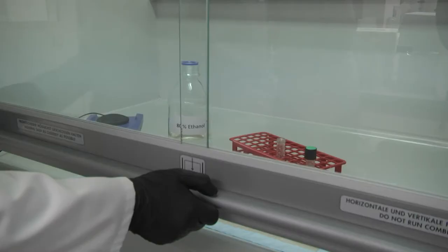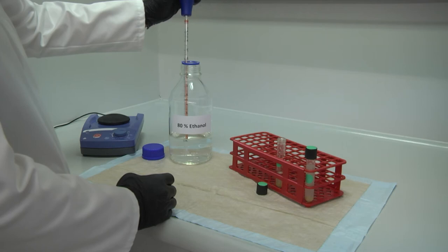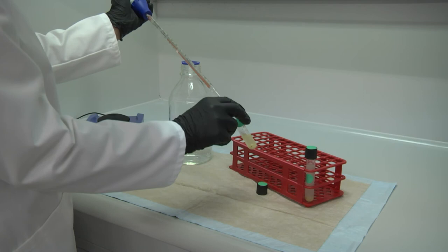Cool down the sample in a chemical hood. Add 7.5 milliliter of 80% ethanol. Make sure the volatile ethanol is not pouring down.